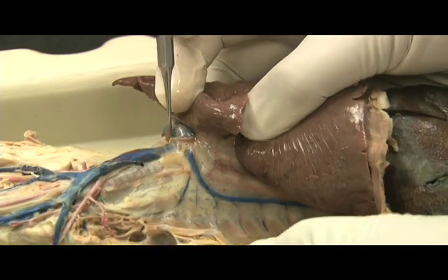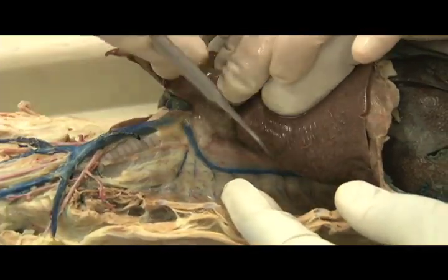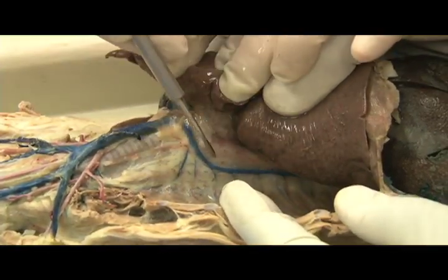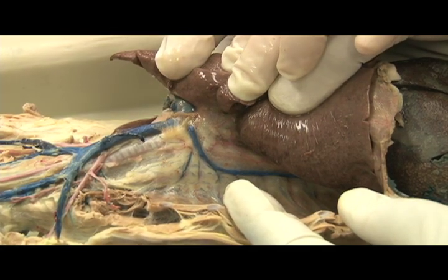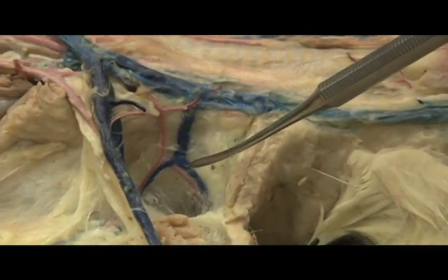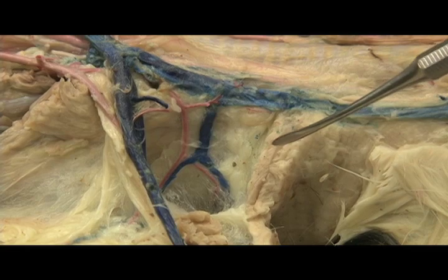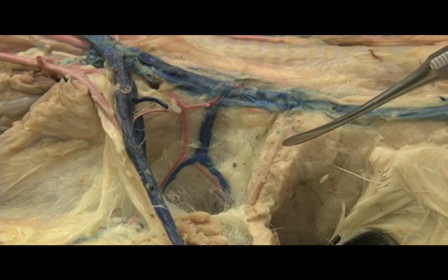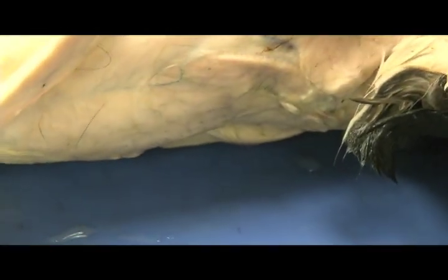In this view, the right lung is pulled away from the thorax. This is the azygous vein, which will drain blood into the superior vena cava. Along the side of the neck is the transverse scapular vein, which will drain blood into the external jugular vein, and draining the back of the arm is the cephalic vein.